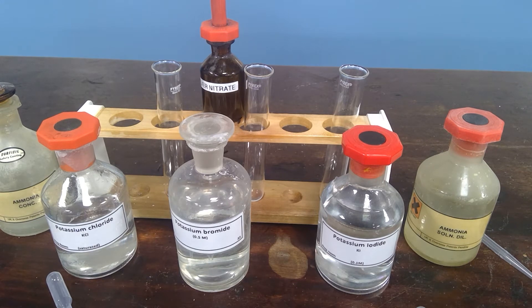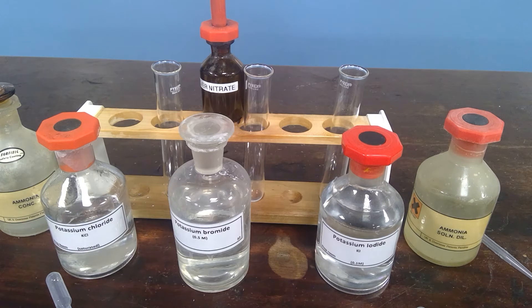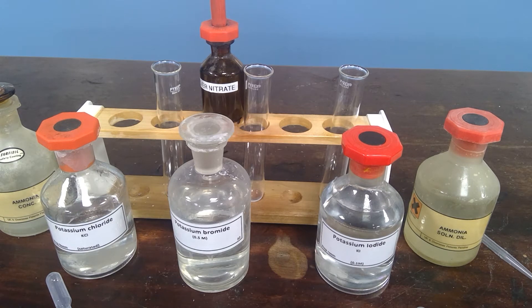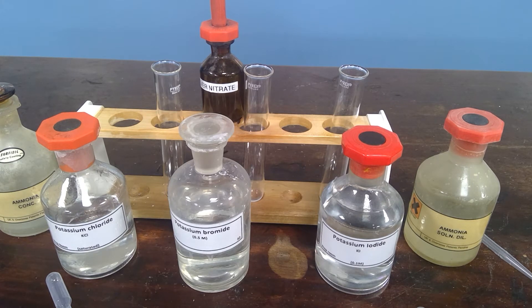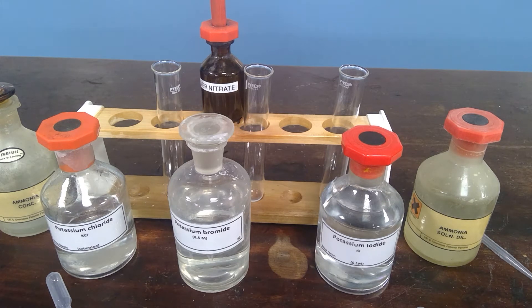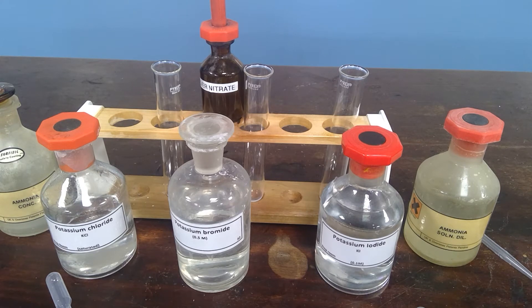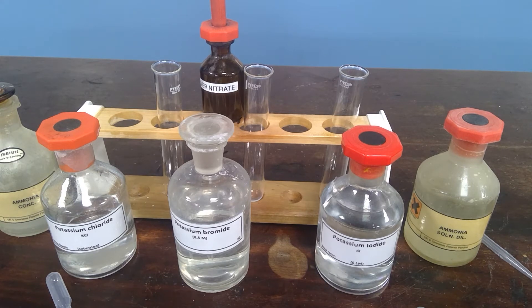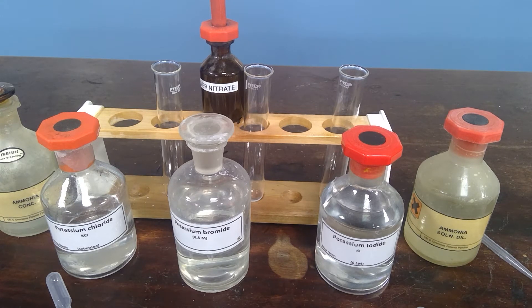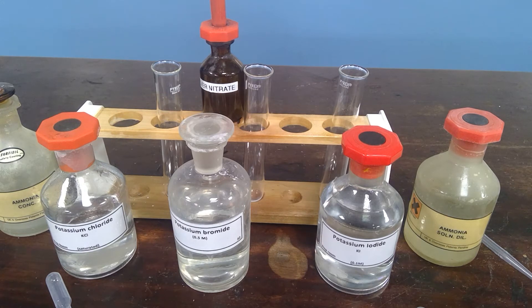We are going to take each one of the aqueous halides and add silver nitrate to it. In each case there is a precipitate. The precipitate colours are difficult to distinguish, but are often listed as white, cream, and yellow.